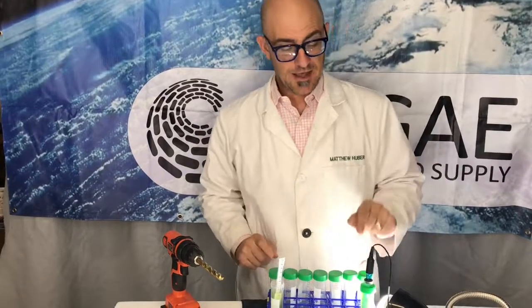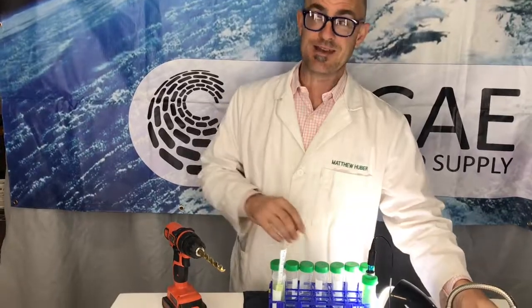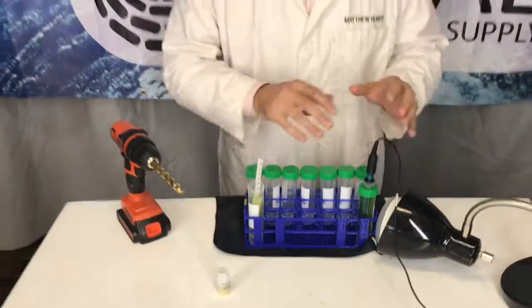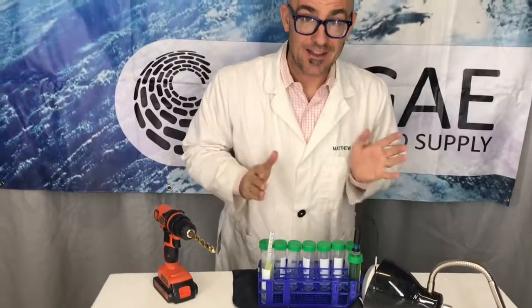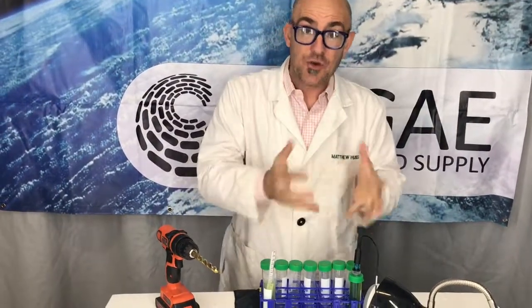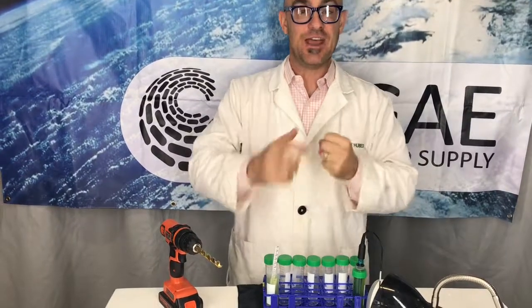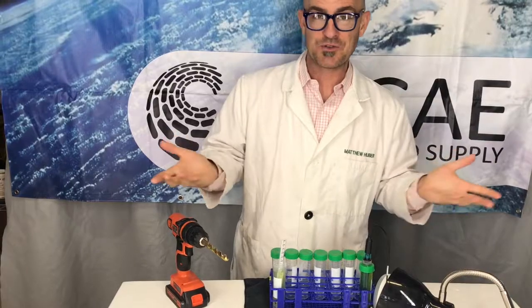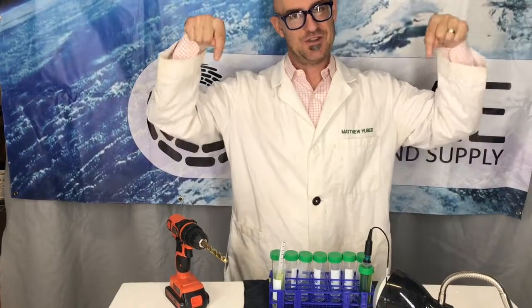The cool thing is, leave this in at night — I can make nighttime happen; that's the power of science. If you leave all this plugged in and data logging overnight, the pH will actually go down, because your algae is going to be respiring, consuming O2, and producing CO2. The CO2 in the water will turn into carbonic acid, driving the pH of the system down.